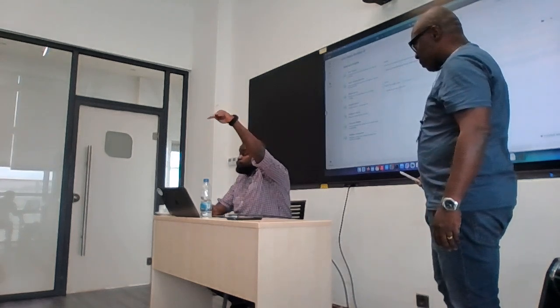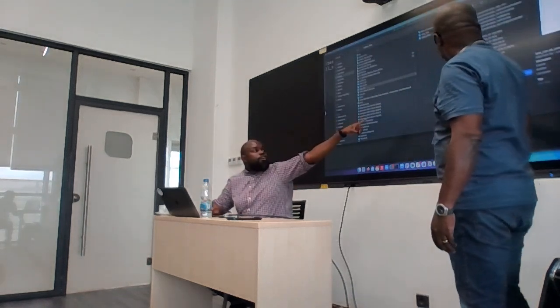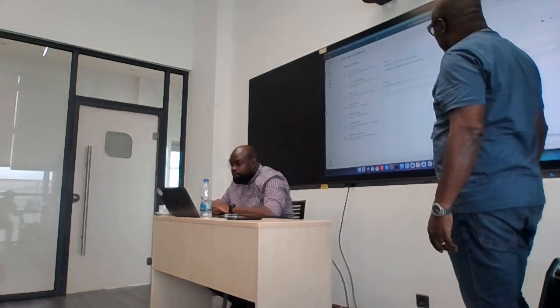No, I just want to show them something quickly. When you are running your Epi2Me, what did you put here? If you put test run like me, my output is called test run dot all consensus dot fasta. If you put your name, maybe run one, your output will be run one dot all consensus dot fasta. So that's what I'm saying. Don't copy mine. Use yours, whatever you named your file.